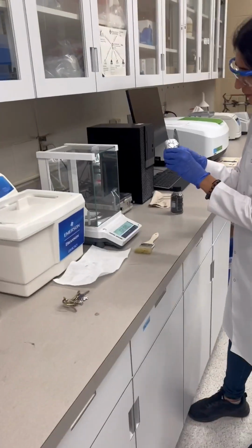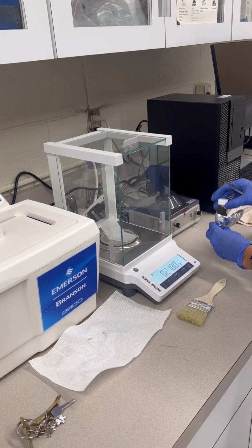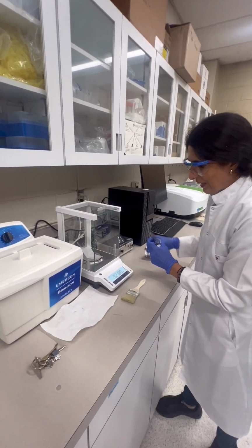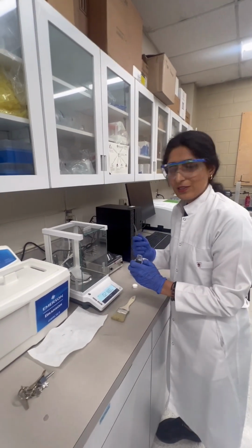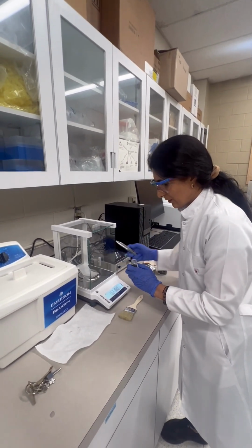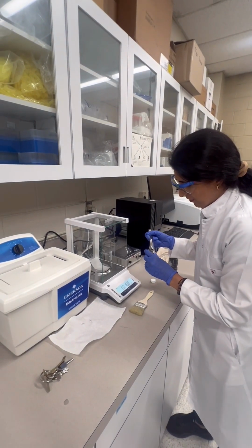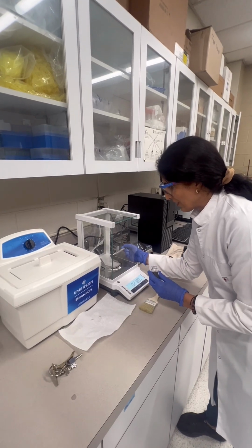So you are adding potassium permanganate. Yeah, now I should add. How much? 1.32 gram, and we should keep it stirring for 6 hours. What is the role of this potassium permanganate? Is it oxidizing? For sure it's oxidation.